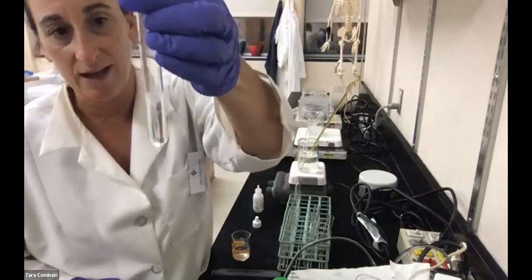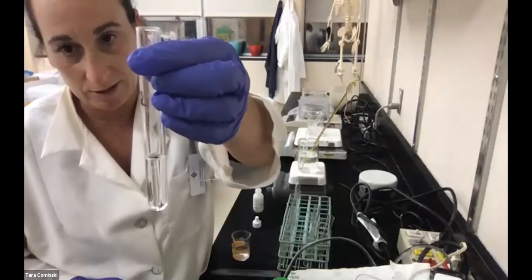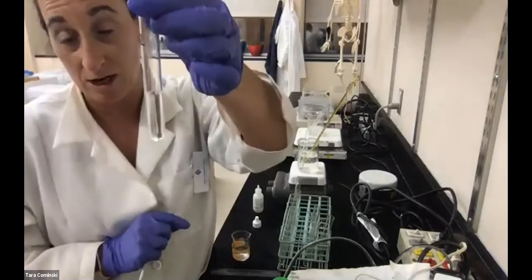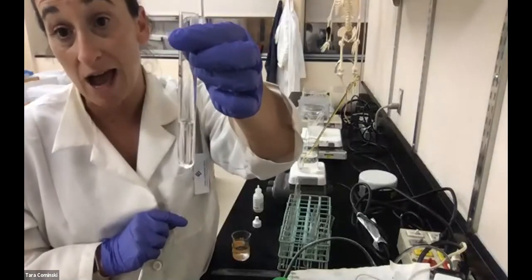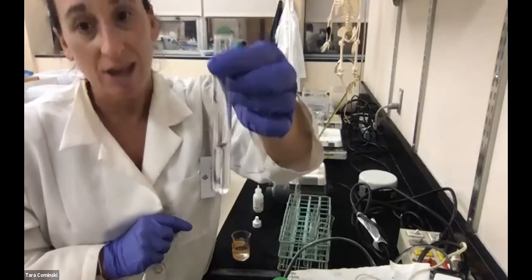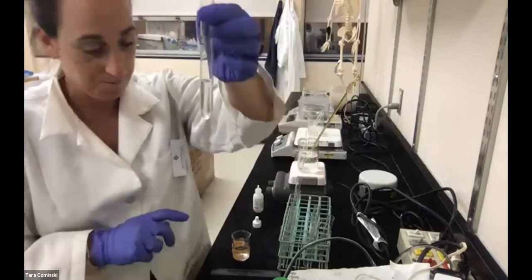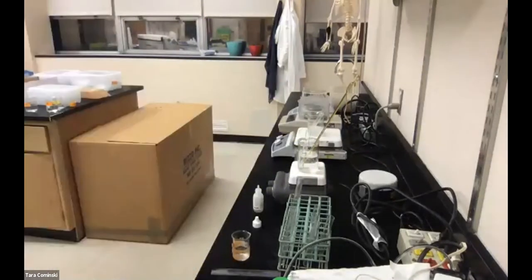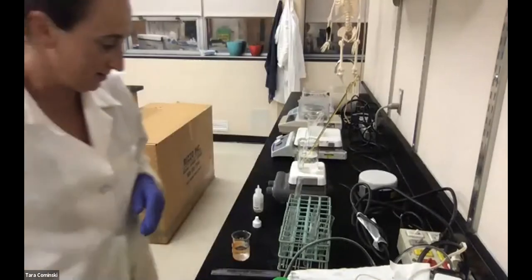There's basically no bubbles, okay? Because our volume of liquid was here, there's no bubbles here. So water and hydrogen peroxide, your bubble column height is 0 millimeters. Think about why that makes sense, okay? All right, now tube 3 will have catalase, okay?